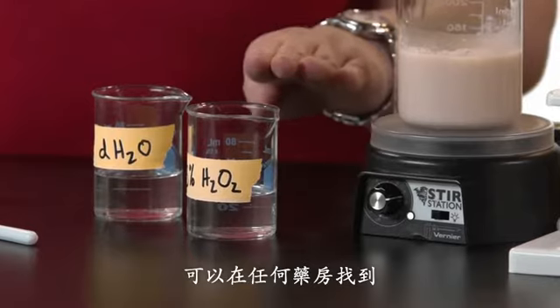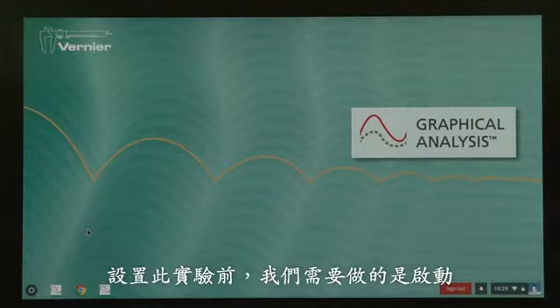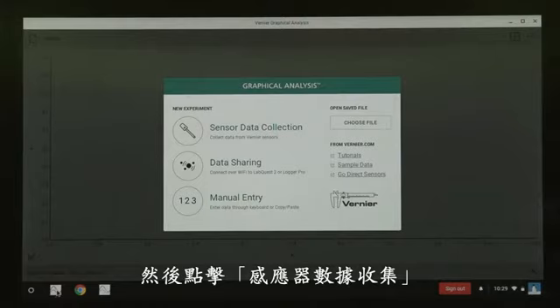So to first set up this experiment, what we need to do is first launch graphical analysis on our Chromebook. And then you're going to click or tap on Sensor Data Collection.